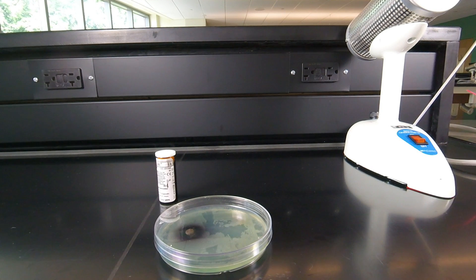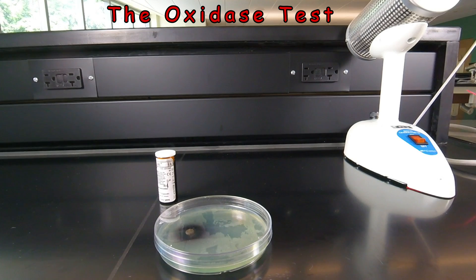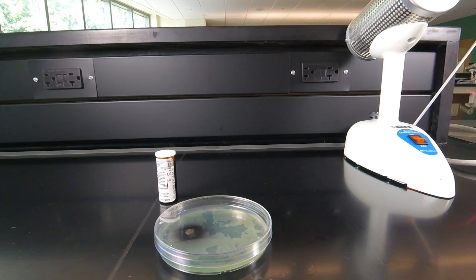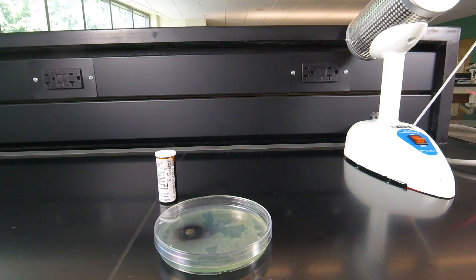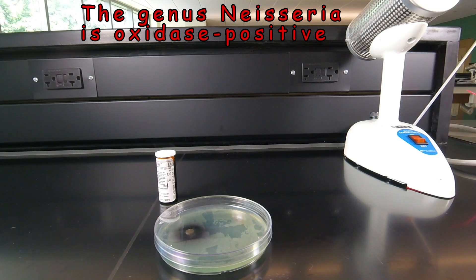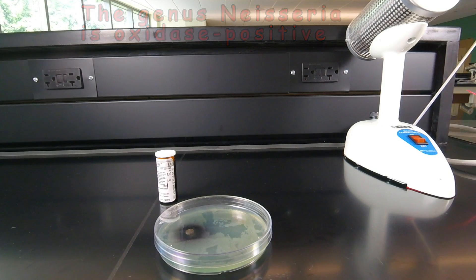In this video lesson, we're going to learn how to do the oxidase test using a Taxo N or oxidase disc. The oxidase test tests for a bacterial enzyme called cytochrome C oxidase and has a number of important uses. It can be used to help identify the genus Neisseria — the N on the N-disc refers to Neisseria. This includes Neisseria gonorrhea, which causes gonorrhea, and Neisseria meningitidis, which causes meningococcal meningitis.